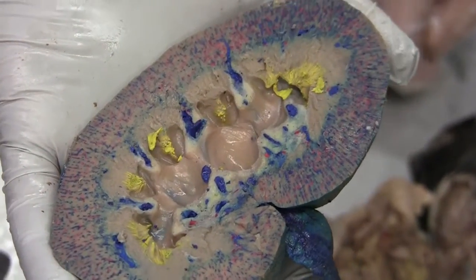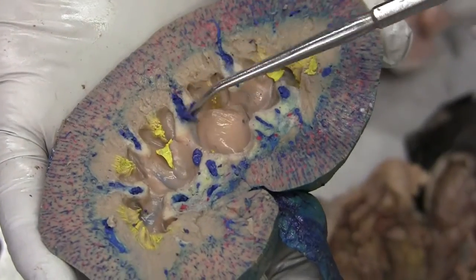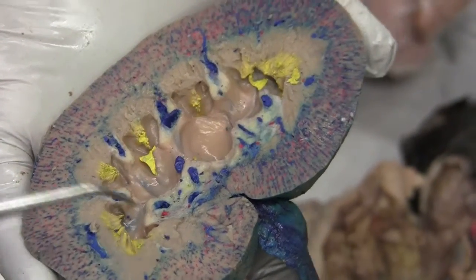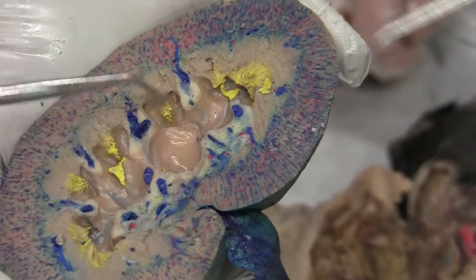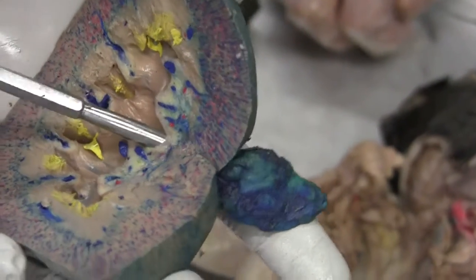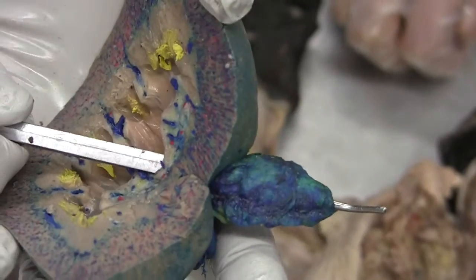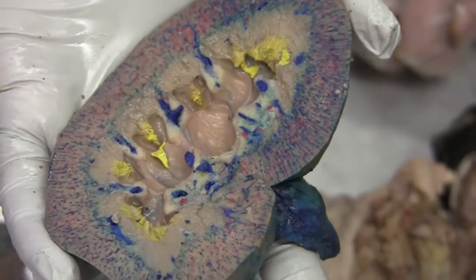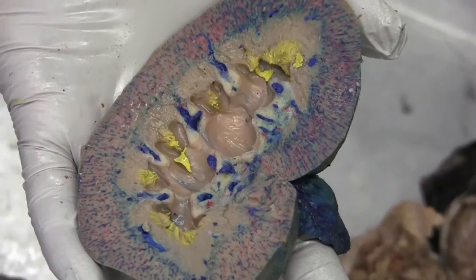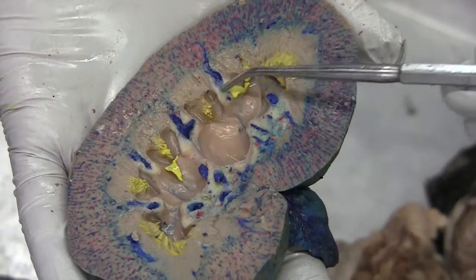Renal columns — these are all renal columns here. Renal pelvis. There's only one renal pelvis — one renal pelvis on each kidney. Renal sinus — this whole thing is the renal sinus.